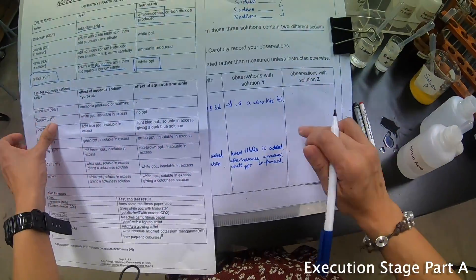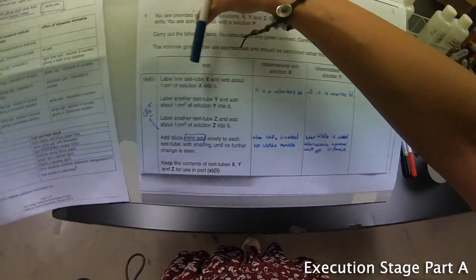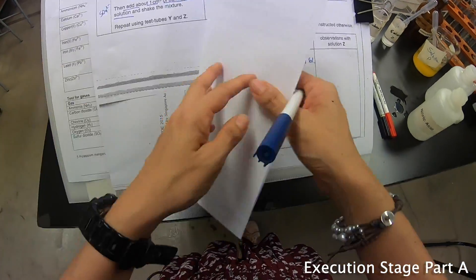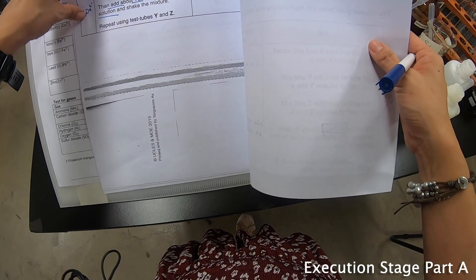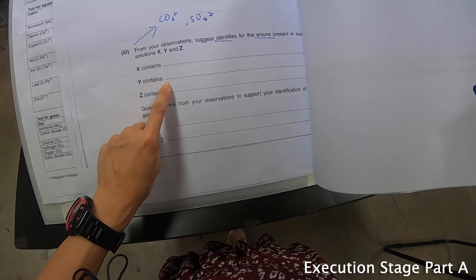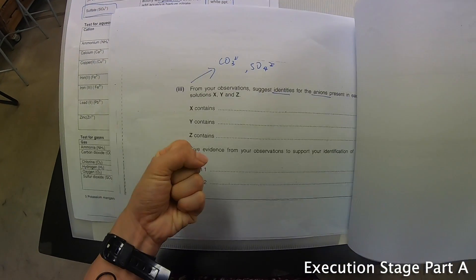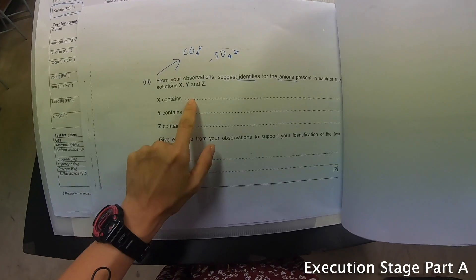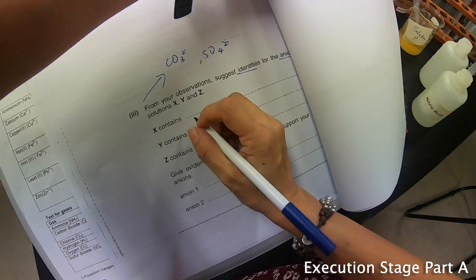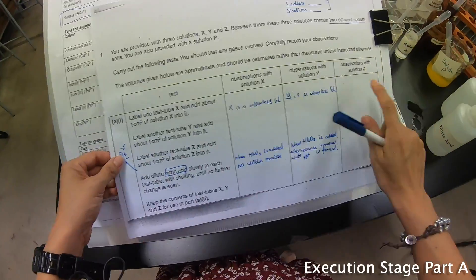CO2 is produced, which means Y contains carbonate. Because Y contains carbonate, I quickly go back to the identity section and write: Y contains CO3²⁻. Let's move on to Z.